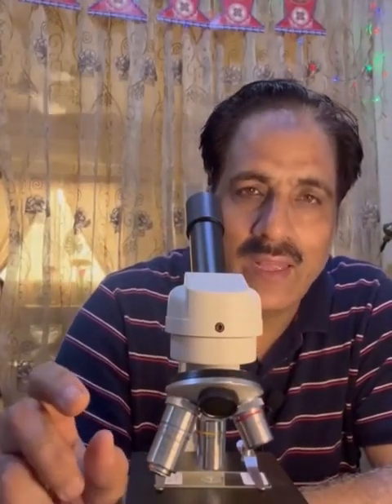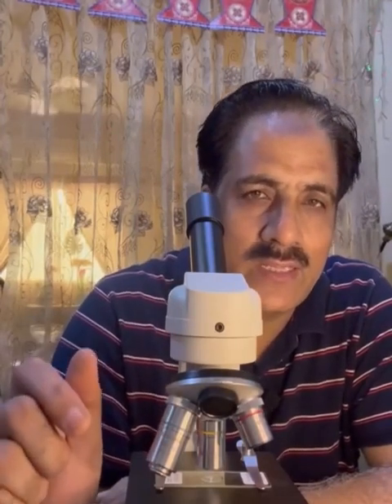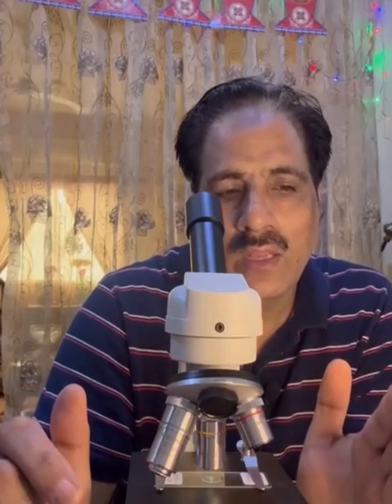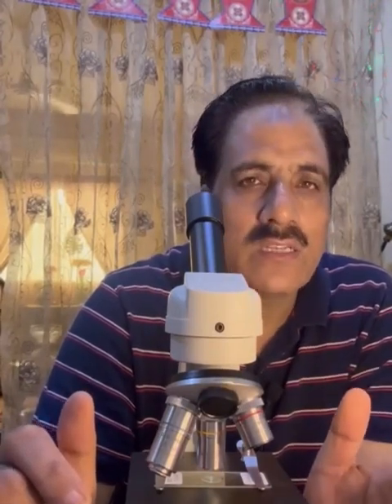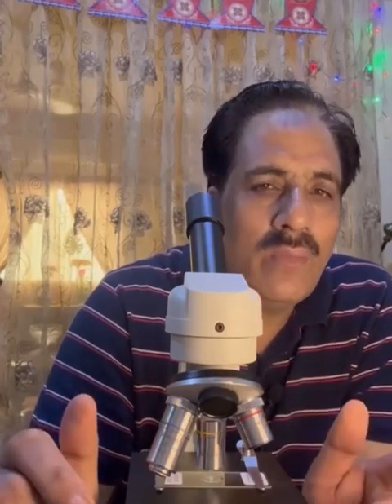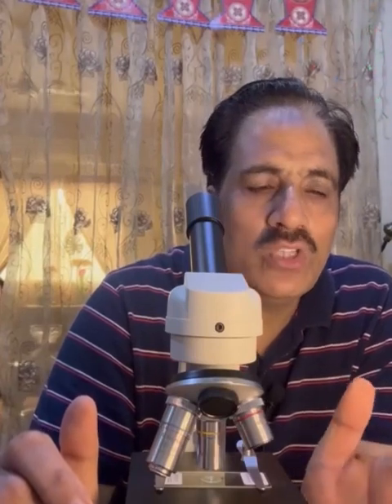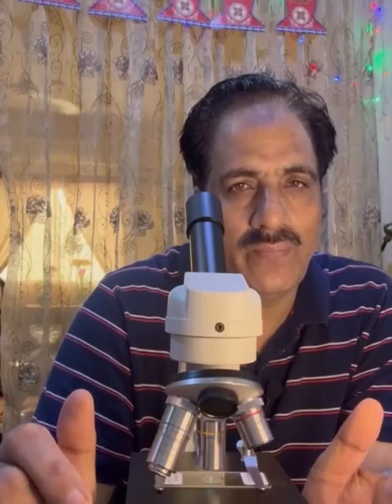We have to make the plan diagram of that portion of the slide which they tell us in the examination paper. So we have to look at it properly. I will demonstrate this on the board, how we will make the plan diagrams of that specific part of the slide that they ask us for. So just remember one thing, that in the plan diagram we don't make the individual cells, we just show the position of the tissues, their relative size and their position.